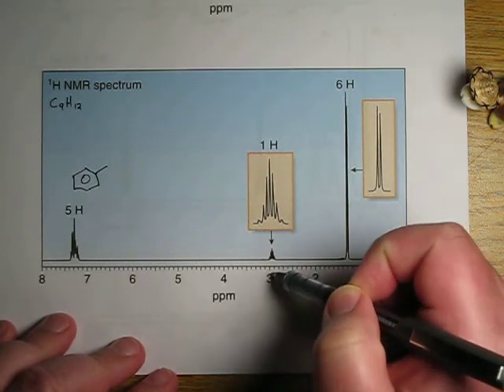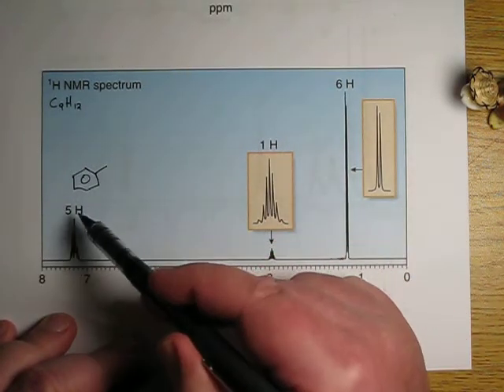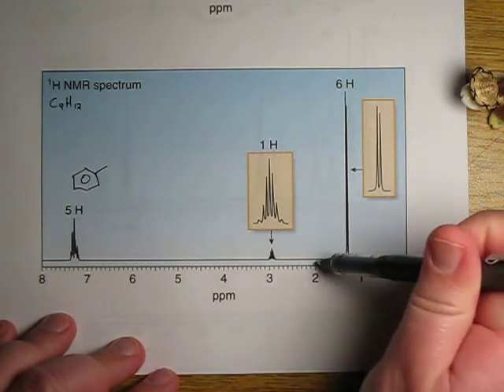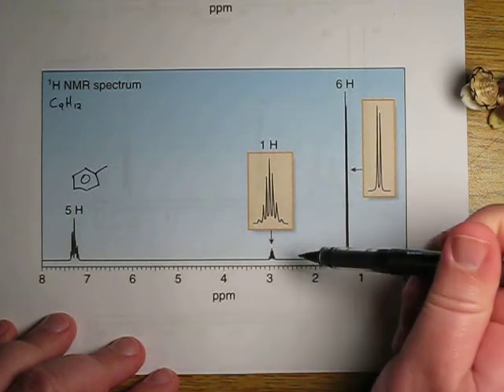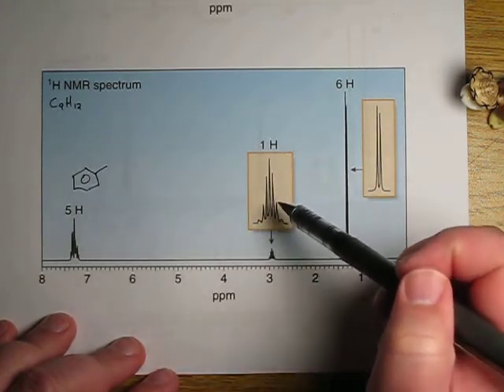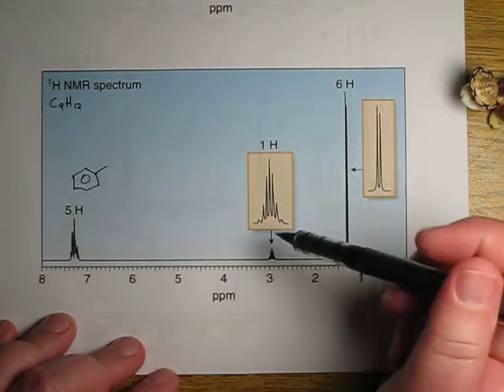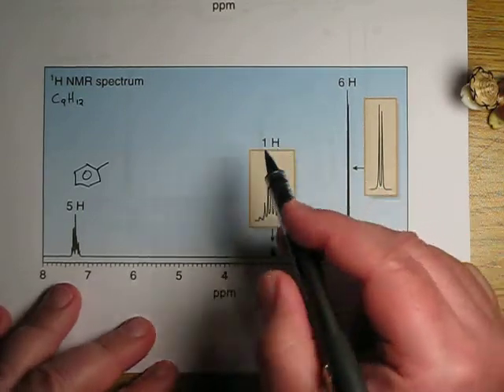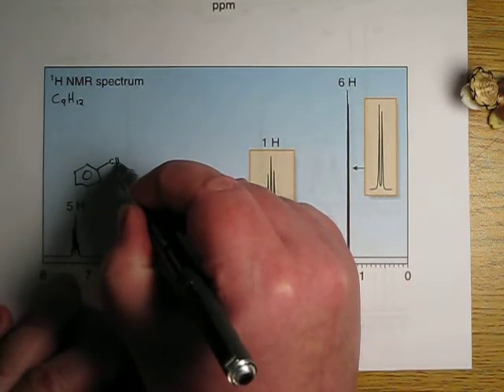There's no nitrogens in here, so whatever this is, it's got to be bonded to this benzene ring. There's no carbonyls that could bring it from 2 to 3. There's no nitrogens that'll bring it around 3. The only thing is this aromatic ring. So whatever this is, it's bonded to that benzene ring. We see it's got 1H on it. So let's just go CH.